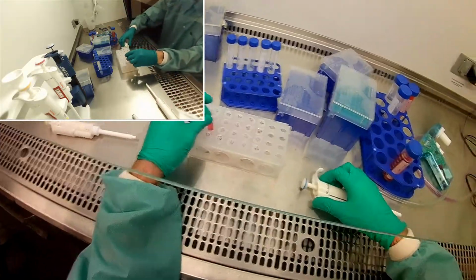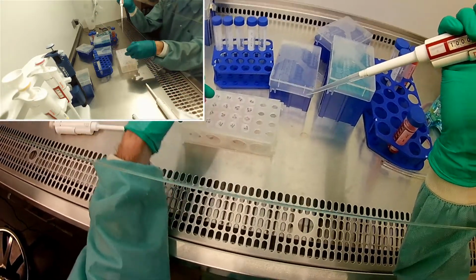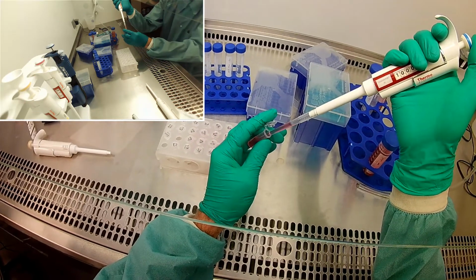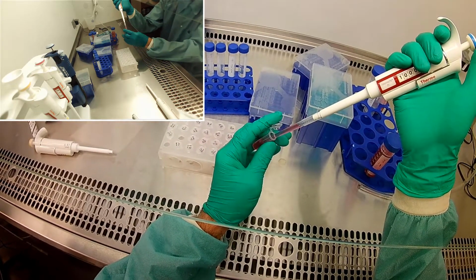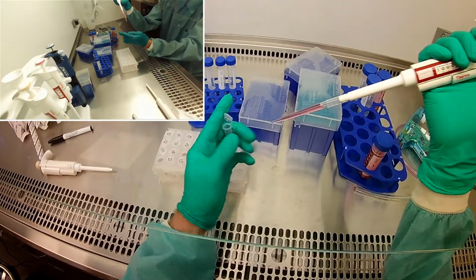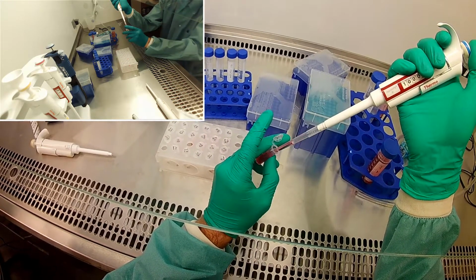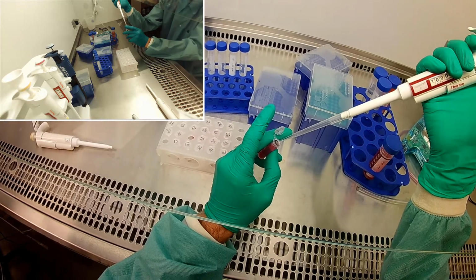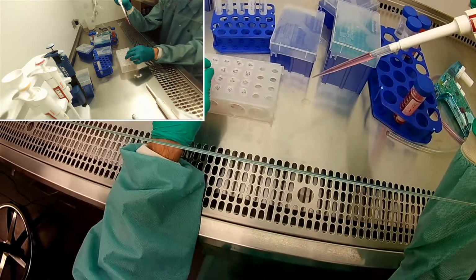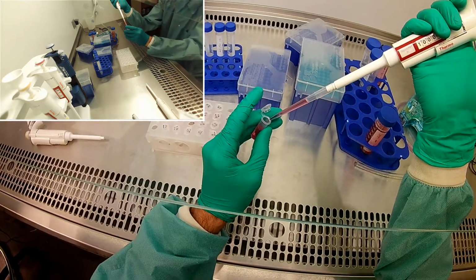Okay, so what I'm going to do is pretty easy then. I got my 8% ethanol. This mixer's mixed. Take a ml of it, put it in a ml of 0% ethanol media, and now I magically have 4%. Mix it in. Take a ml of that. Put it in 2%.